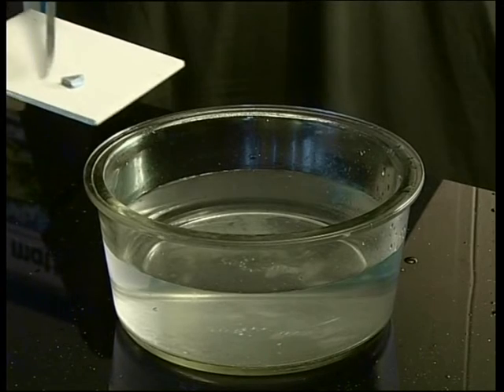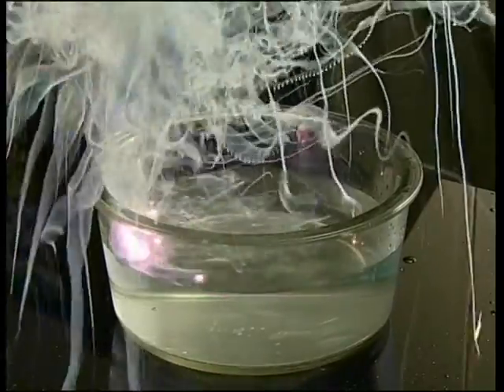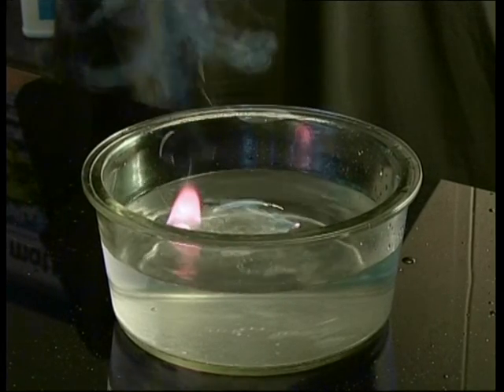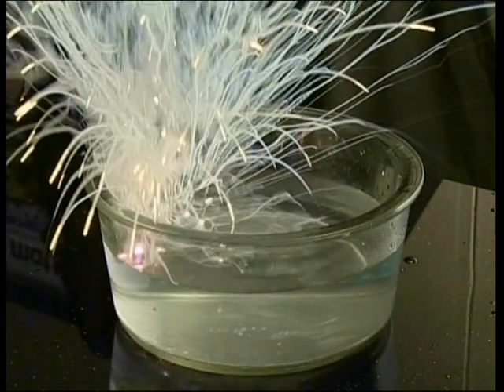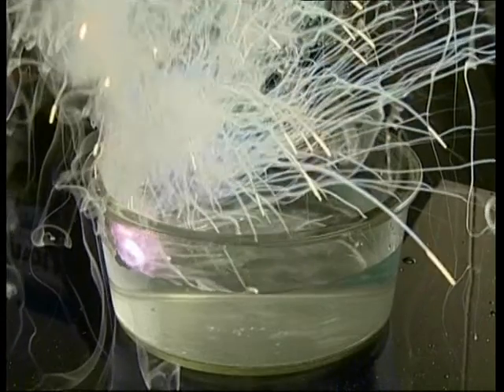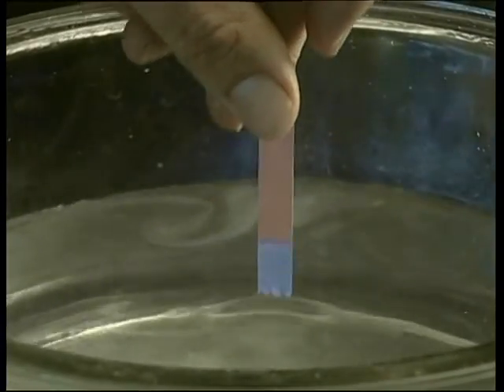We have previously predicted that the reactivity of elements in group 1 increases from the top to the bottom of the group. Does this information help you to predict something about the vigour of the reaction of potassium and water? The piece of potassium reacts so fast that it explodes spontaneously and ignites with its characteristic lilac-purple flame. The reaction is much more vigorous than either of the previous reactions and a large amount of gas is released very quickly. A high-pitched popping sound can be heard as the potassium whizzes around the top of the water. Red litmus paper turns blue when dipped into the water. The popping sound confirms that the gas being released is hydrogen, and the colour change indicates that a basic hydroxide has formed.